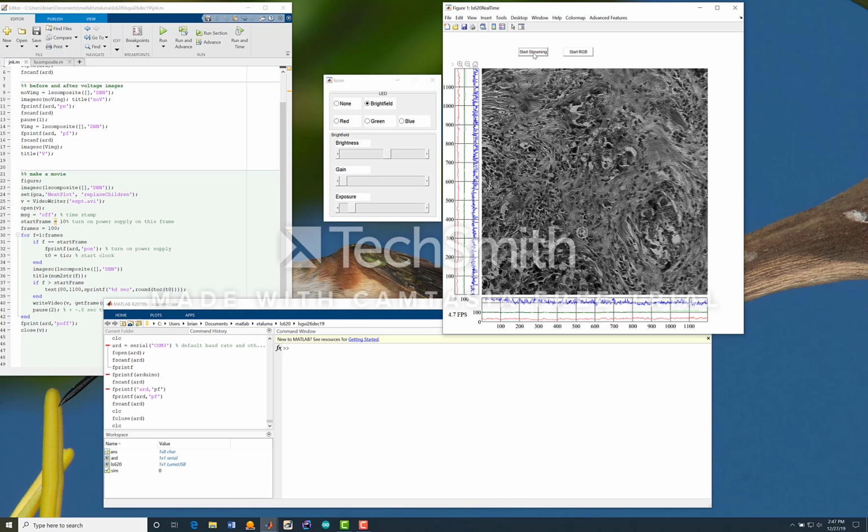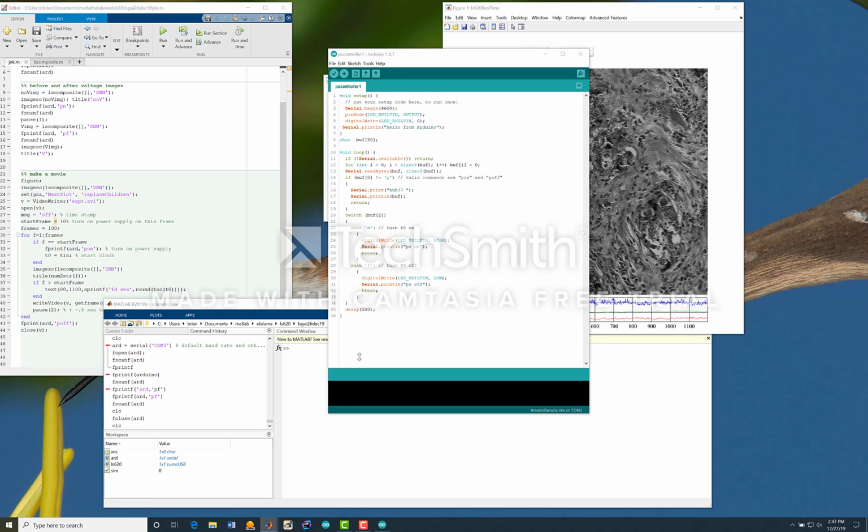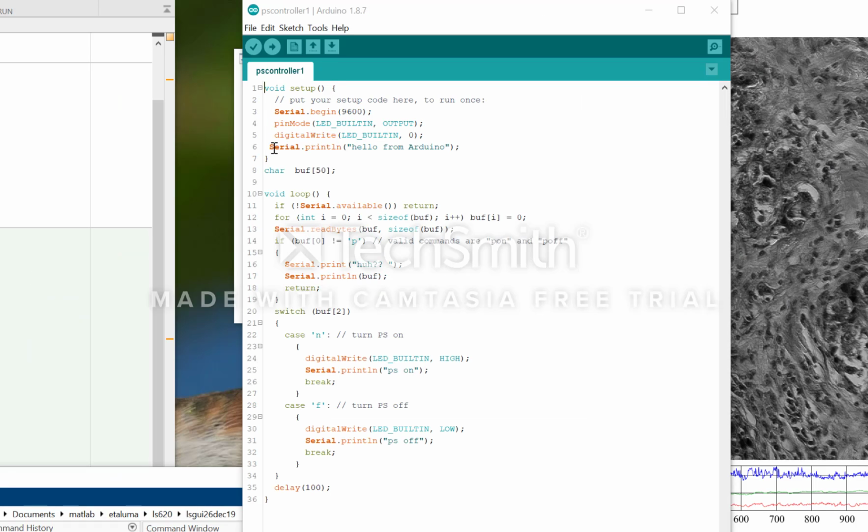I'll conclude with a final demonstration of integrating an external device with the microscope using MATLAB. The device I'm going to be talking to is an Arduino, a little microcontroller that will control a microfluidic device ultimately placed on the stage of the lumascope. The microcontroller is programmed via this code here. After a little bit of setup, the loop says if there's serial data, then read the serial data and switch based on the third character, whether it's an N or an F. If it's an N, turn on the power supply. If the command is POFF, then turn off the power supply.